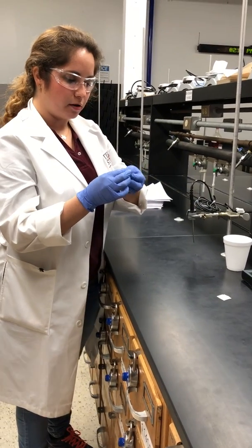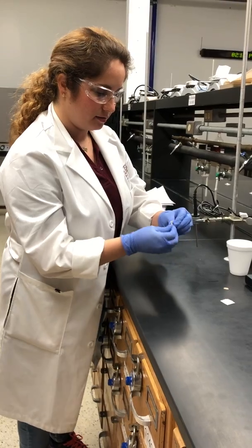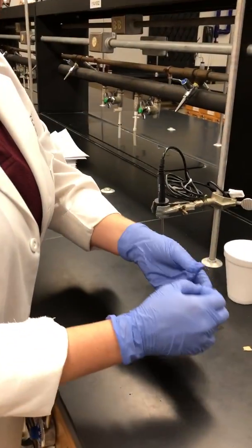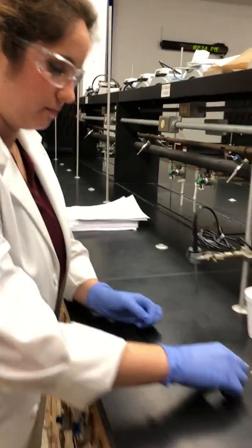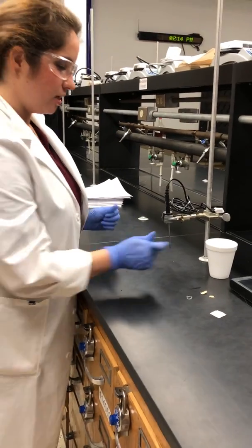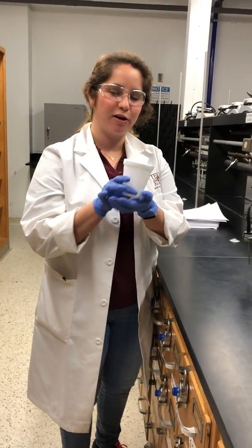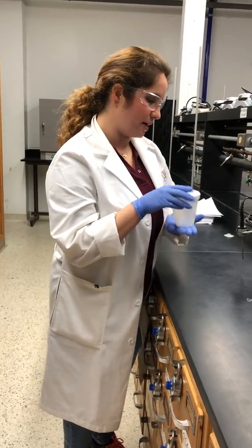The filter paper will go into the solid waste, but please try to reuse your rubber band. The rubber band can remain intact and reusable even after removing the filter paper. Also, please try not to destroy your styrofoam cup — it is a scourge on the planet and we're hoping to reuse these all week. Have a great lab!